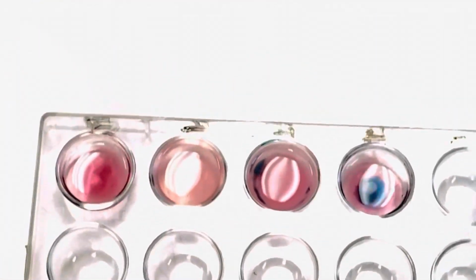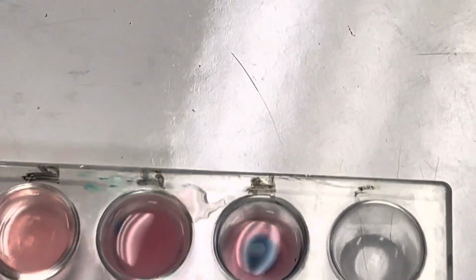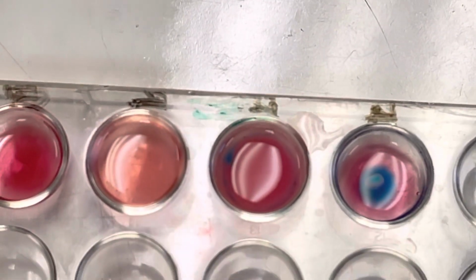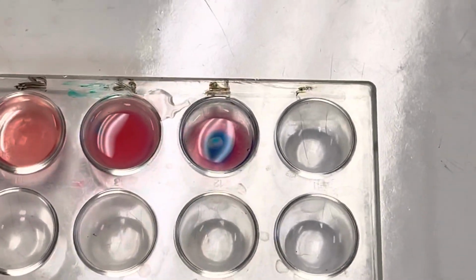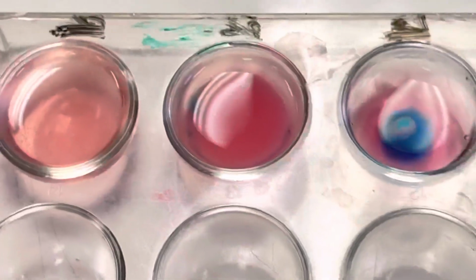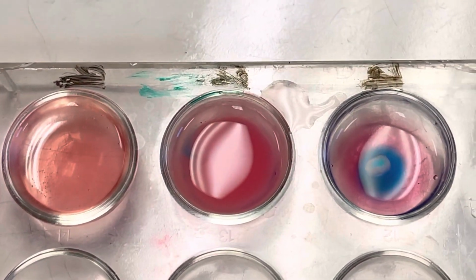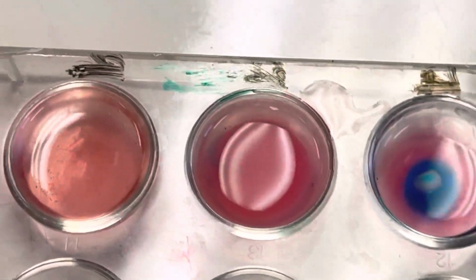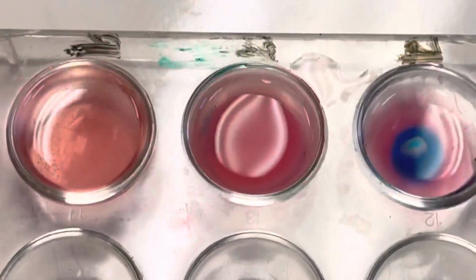This is somewhat disappointing. Because the colors look so good in person. It's so easy to tell what's happening, but it's harder to tell on video. I don't know why that is. But we can see that it actually turned back to pink. So the blue is now, there's still a little bit of blue right there, right? But it seems mostly pink now. And it's kind of hard to tell on video, but it's also kind of cloudy now, whereas the other ones are definitely clear. This one's definitely cloudy.